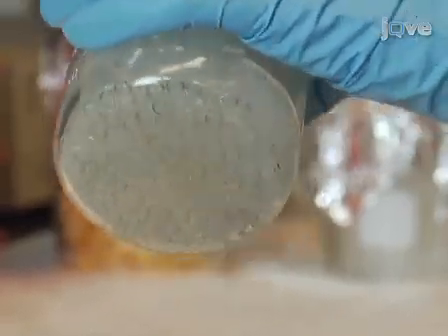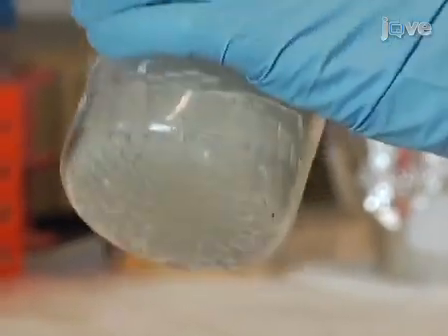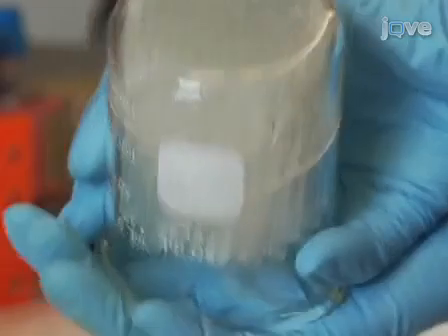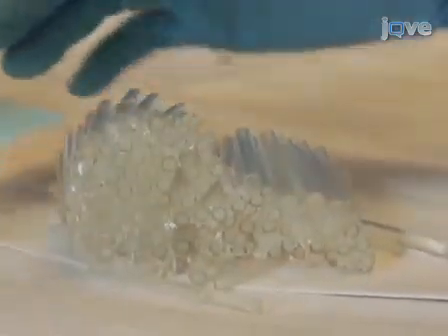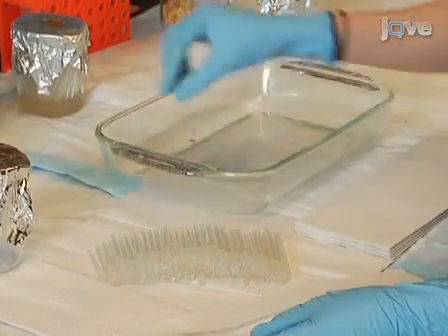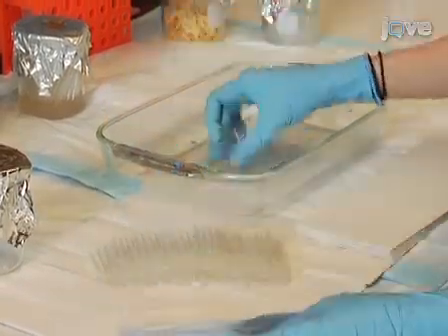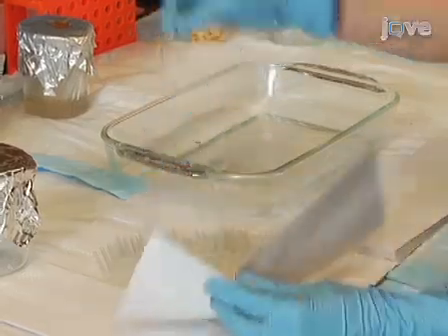To remove the activity tubes from the beaker, push the tubes towards the bottom of the beaker and twist the tubes at the same time so that the solidified food inside the tubes and the bottom of the beaker will separate. Take the tubes out of the beaker, preferably as a single bunch. Next, clean the tubes one by one with paper towels to remove excess food on the outer surface of the tubes. Set the tubes aside in a clean container.